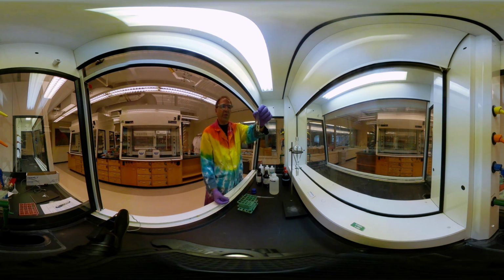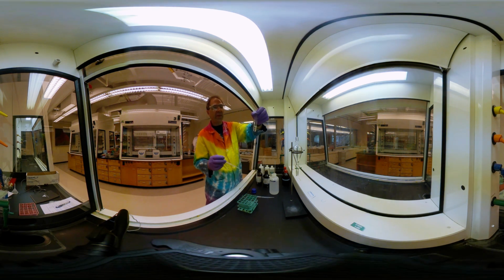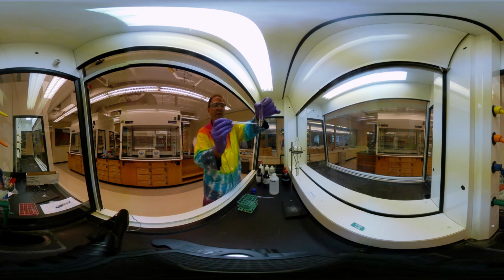All right, hopefully you saw a couple things happen at once. One is that we actually have 2 layers. Now, I have some bubbles in there, so it's a little hard to see the 2 layers. Let me see if we can mix that. There we go. Okay, so there's a boundary right here between the 2 layers.